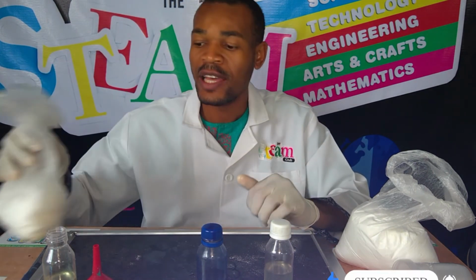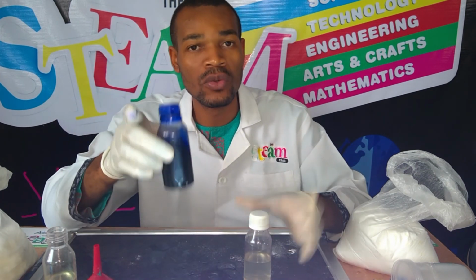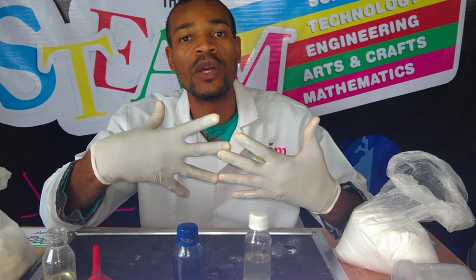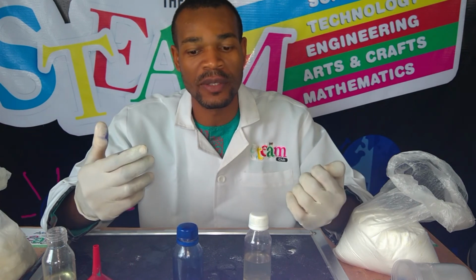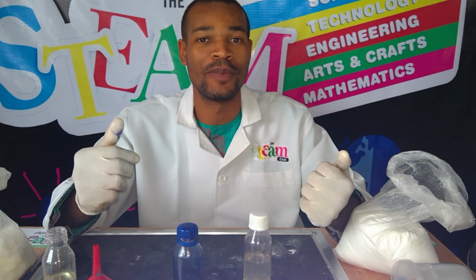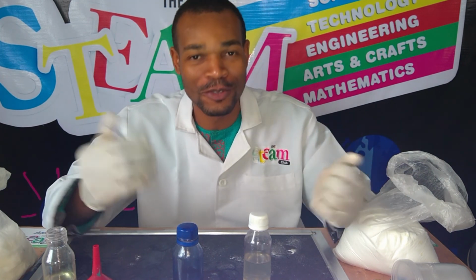So it's the same thing that this potassium hydroxide is doing in this solution. It is not really involved, so to speak, in this reaction. It only provides the opportunity for the methylene blue and the glucose to have a productive interaction, and for that redox reaction to take place. So that is that for this particular experiment. So you can reenact this experiment at home and have fun doing it.